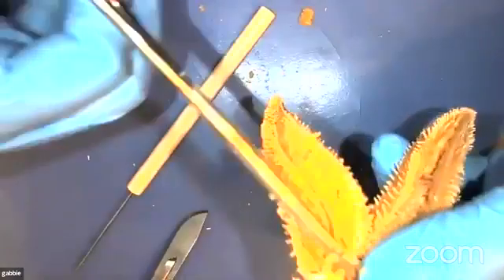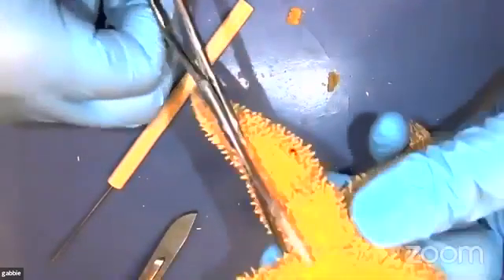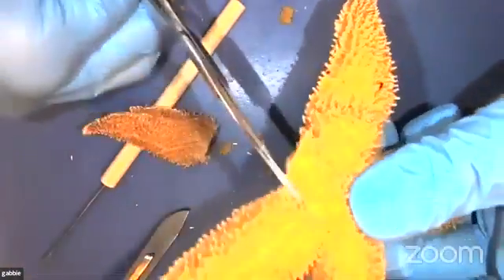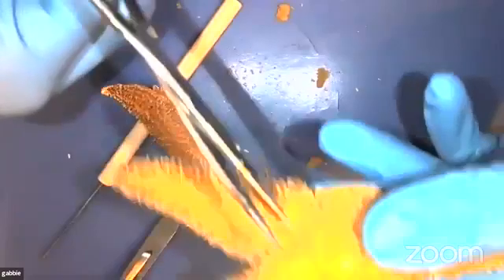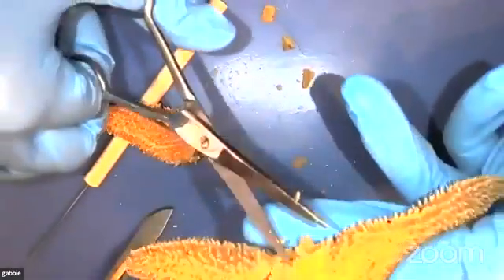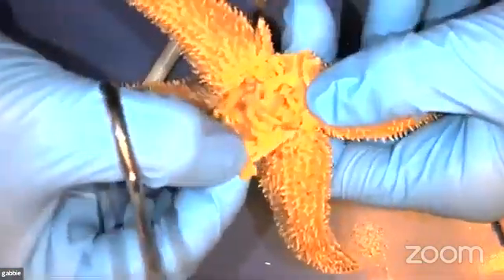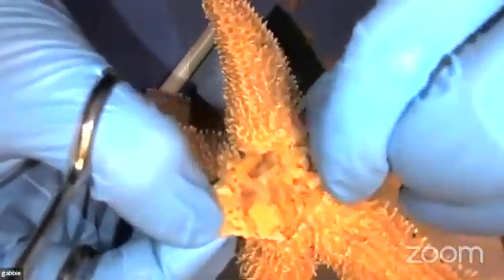If we cut further up, actually, we're going to cut it from this side now. We're going to cut to try and get into that central disc there, and we can take a look at the stomach. Just go ahead and cut that arm off and then cut around the central disc here. Again, very sturdy, helping protect the sea star. We're going to leave that madreporite intact because we might be able to see some of the cool water vascular system.